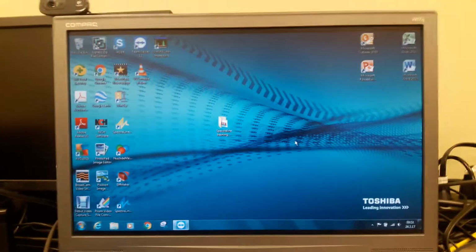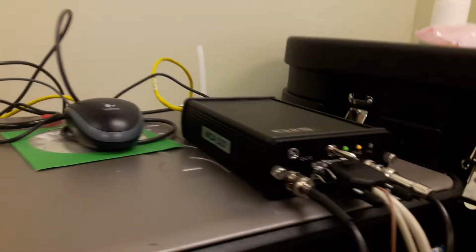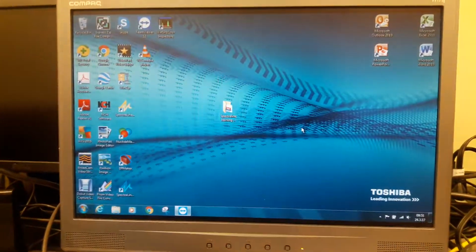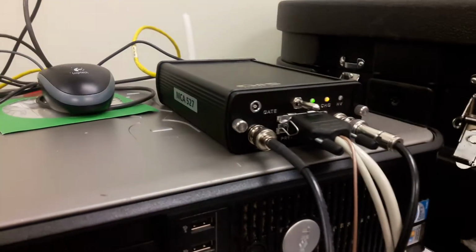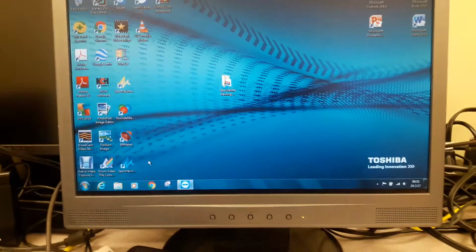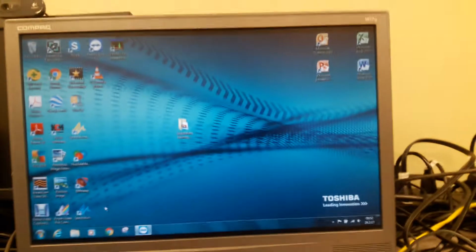Okay, in this segment we will demonstrate to you the importance of the powering sequence of the GBS 527 MCA system while using the SpectraLine GP software. We have found that if the GBS MCA system is turned on before the SpectraLine GP software is running, then the software will not be able to find the device.